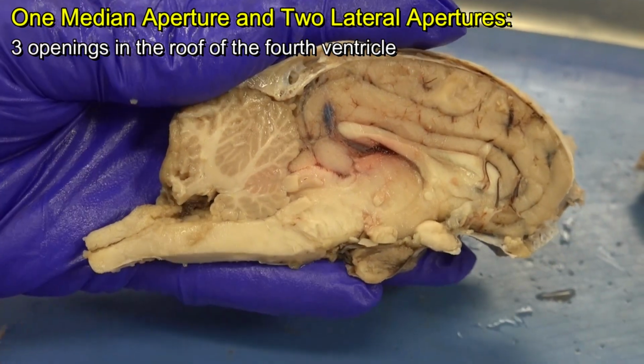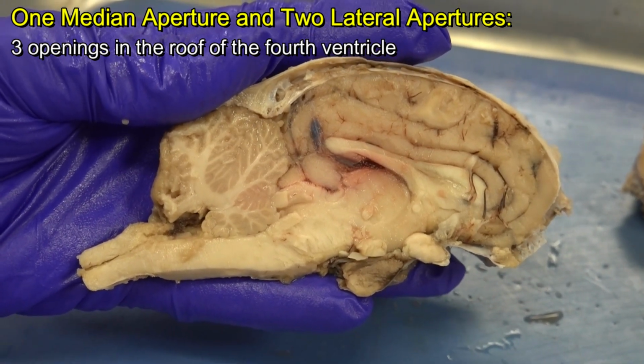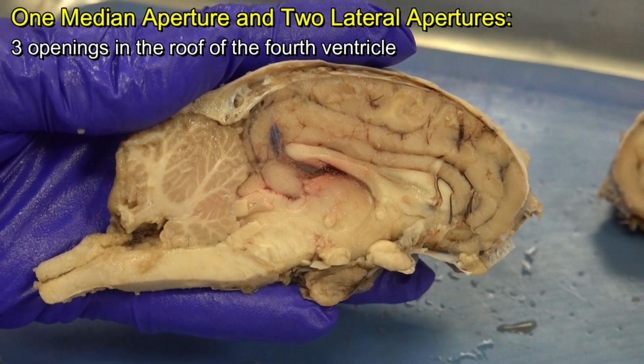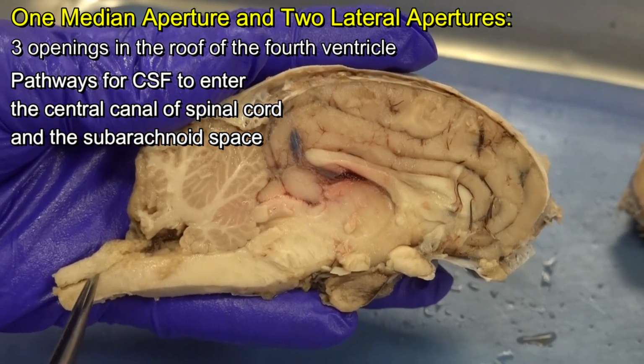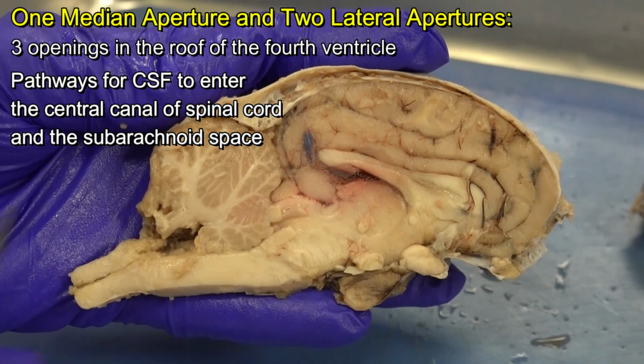So we find three openings, one in the middle that is called the median aperture, and two on both sides, we call them lateral apertures. So through the median aperture and lateral apertures, cerebrospinal fluid from the fourth ventricle gets into the central canal of the spinal cord and subarachnoid spaces of the brain and spinal cord.